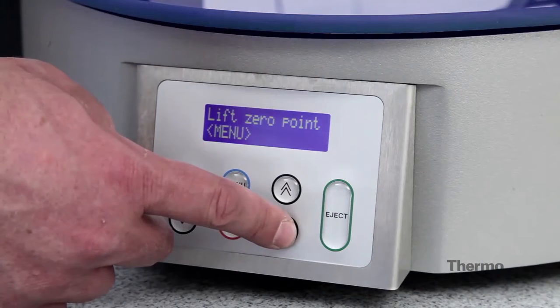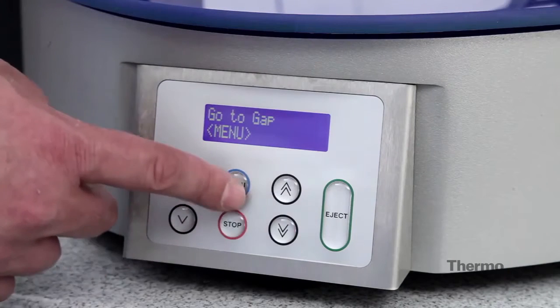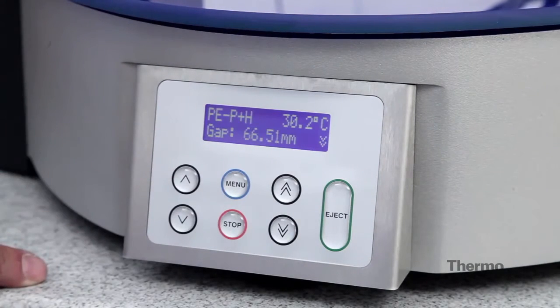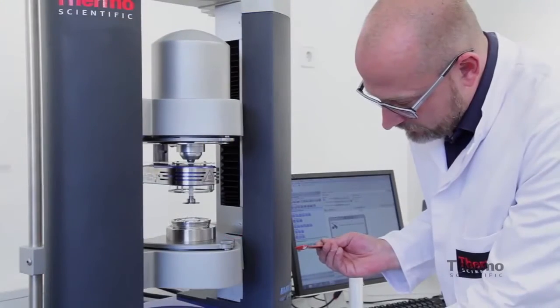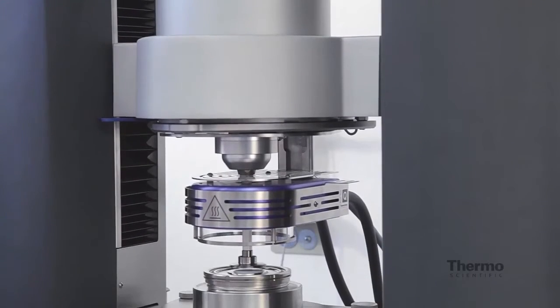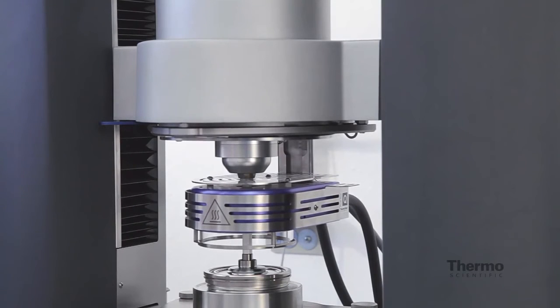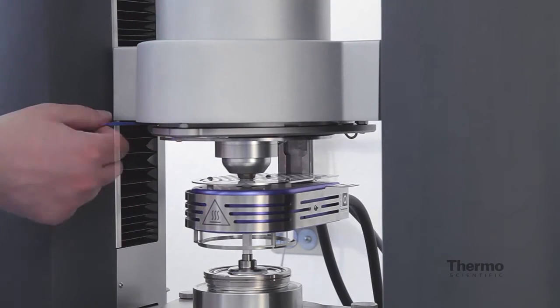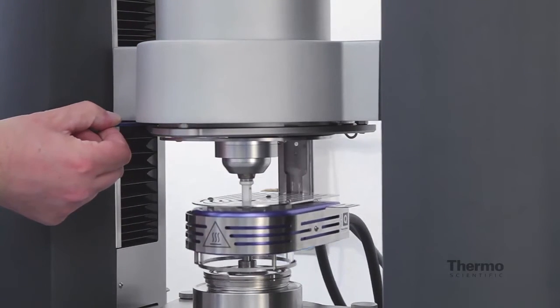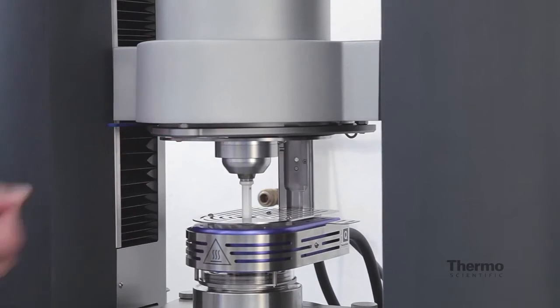Use, for instance, the display unit to go to the gap that is automatically saved into the firmware of the system. The measuring head will lower down and all you need to do is to lower the upper temperature control by pulling the lever.